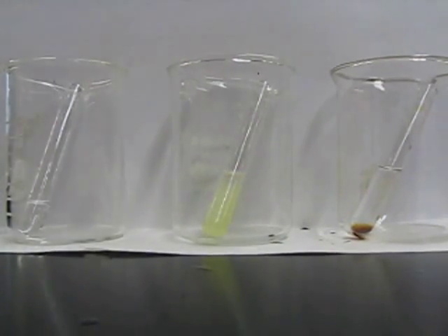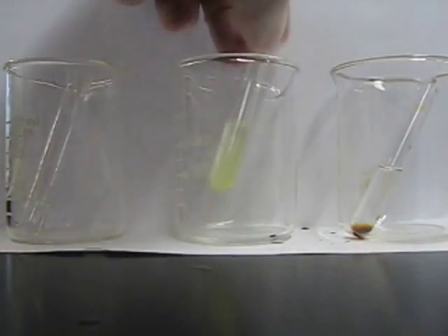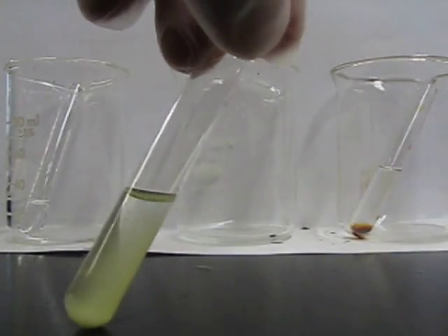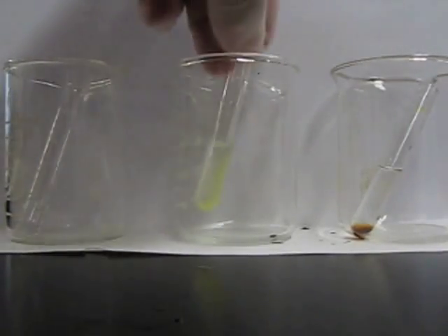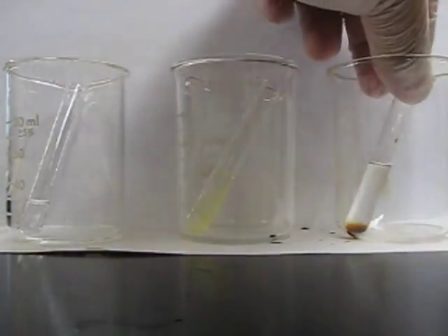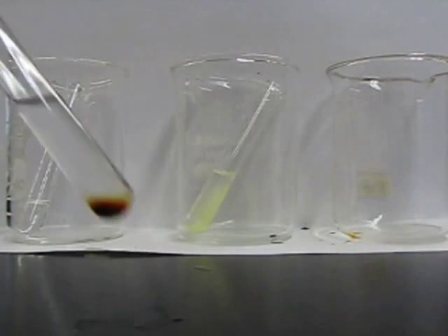Then, what we're left with here—where we have the precipitate, that is the 2-butanol. The one that has no precipitate, just the iodine left, is the 1-butanol. So that's the results for the qualitative testing of these alcohols.